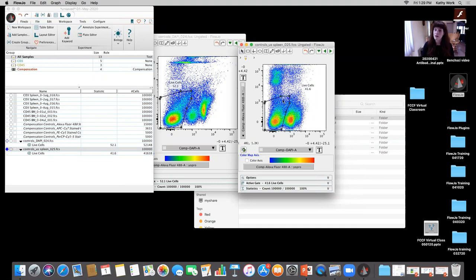Okay. So it looks like this actually is a perfect example and something I wanted to bring up. If you don't have a true unstained, it's going to be a little bit more difficult to set the appropriate gates. So whenever we say unstained, that doesn't mean the inclusion of viability dye, apoptotic markers. Sometimes people might come and they'll say that this is an unstained line, but it's actually including a fluorescent protein or something along those lines. And we wanna make sure that whenever you're utilizing controls, we're mindful of the language that we use, because all cells do have autofluorescence. There's molecules in the cells that will be excited by certain laser lines and emit, typically within the 400 to 550 range or so. And that's a general range, but just be mindful that we wanna have a good understanding of where our autofluorescence is.